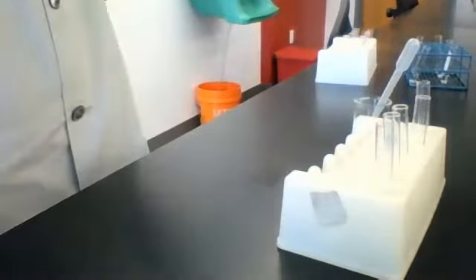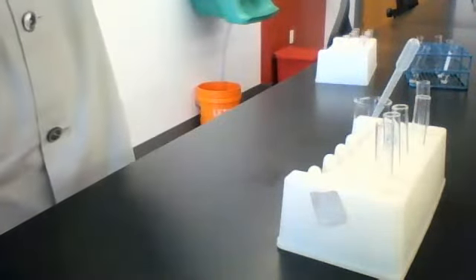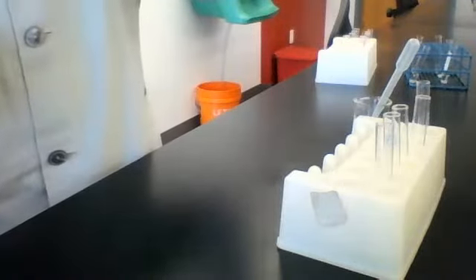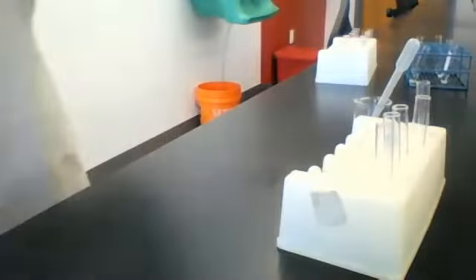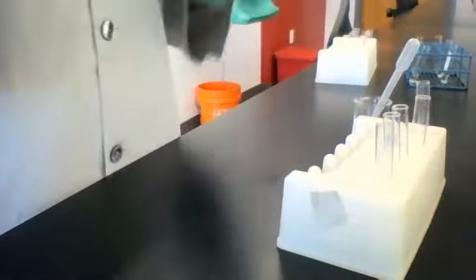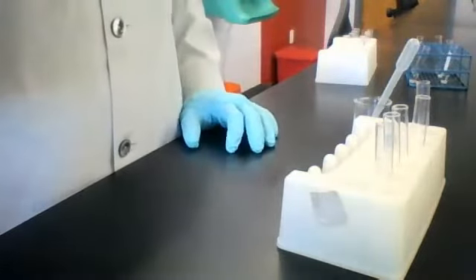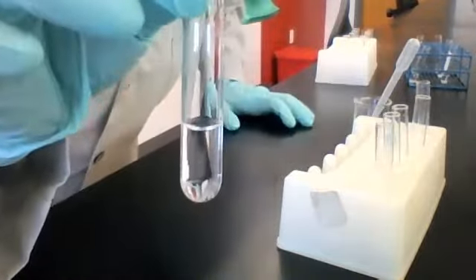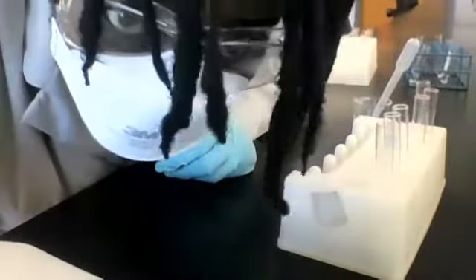We don't have H. No problem. So we're on the third row where the reagent is HCl. All right, this one, no visible change, no change. Let me go ahead and write those last two in the chat and then we'll move on.